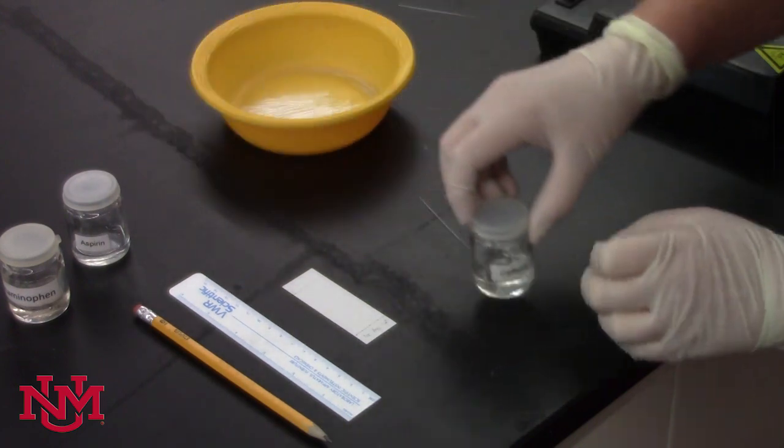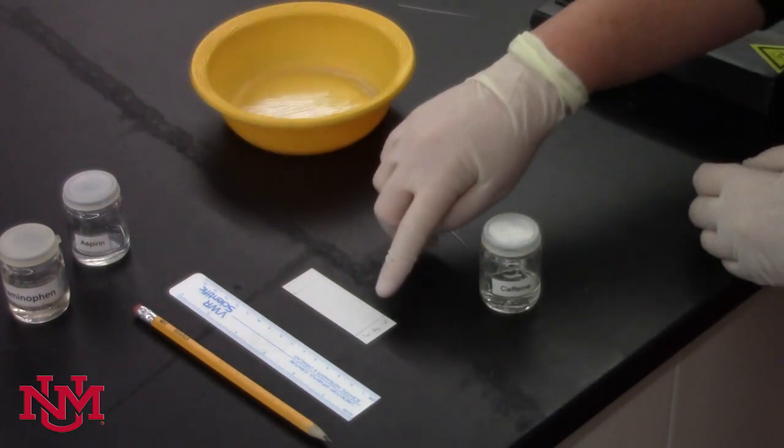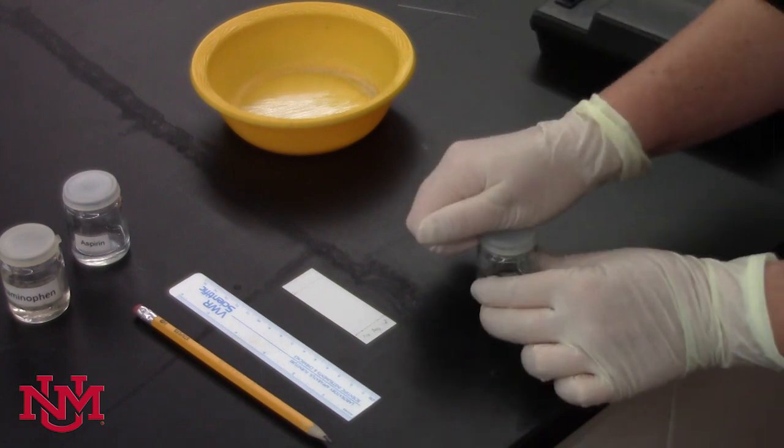Sometimes aspirin is difficult to see, so we're going to check that in a second, but try to touch aspirin many times to your TLC plate.